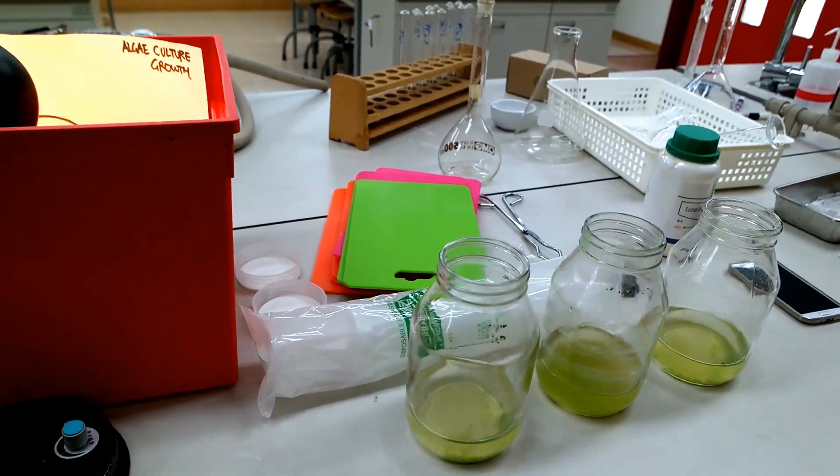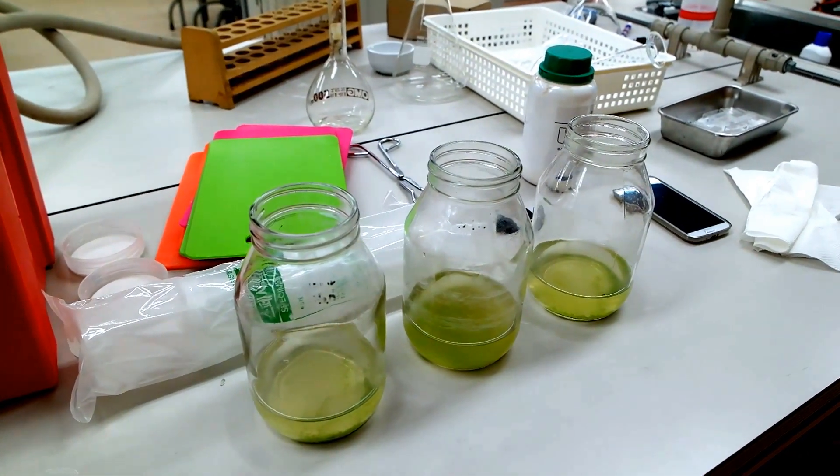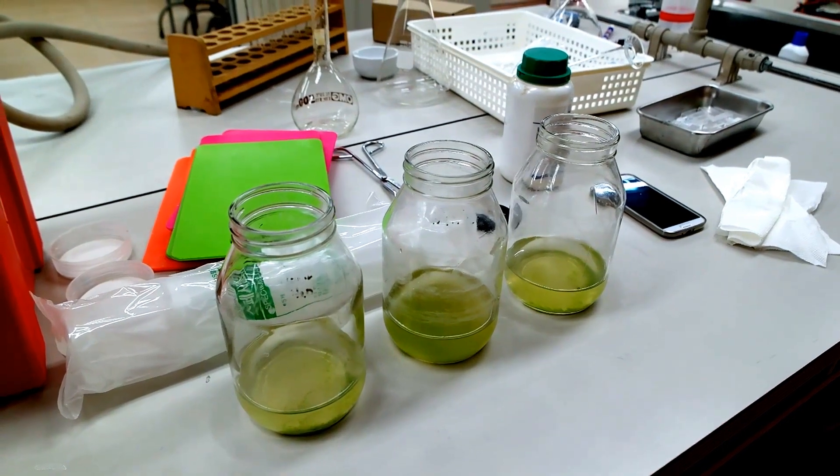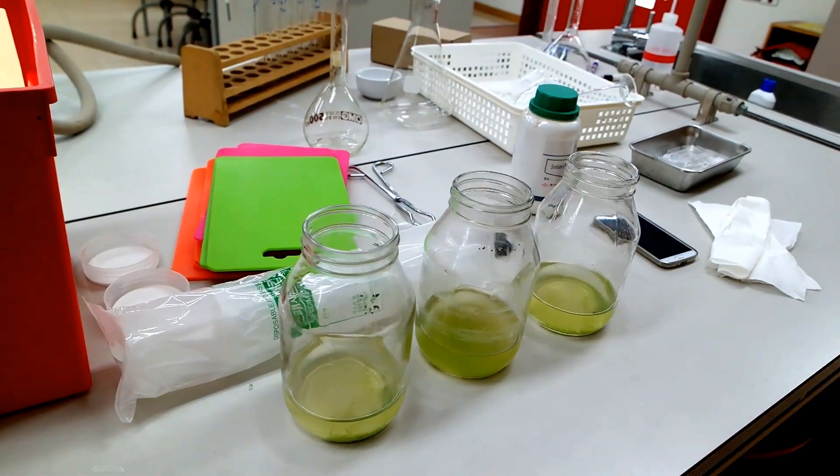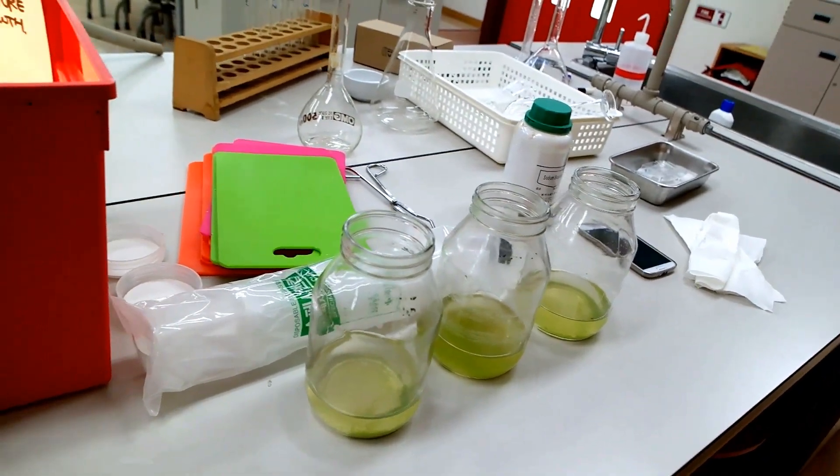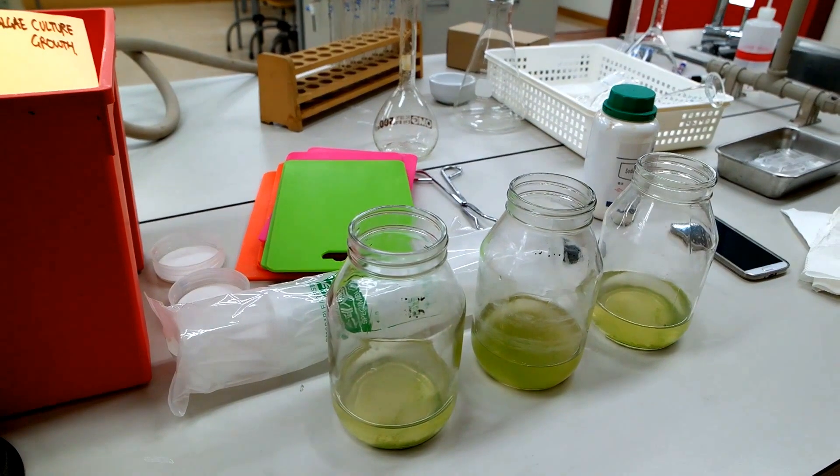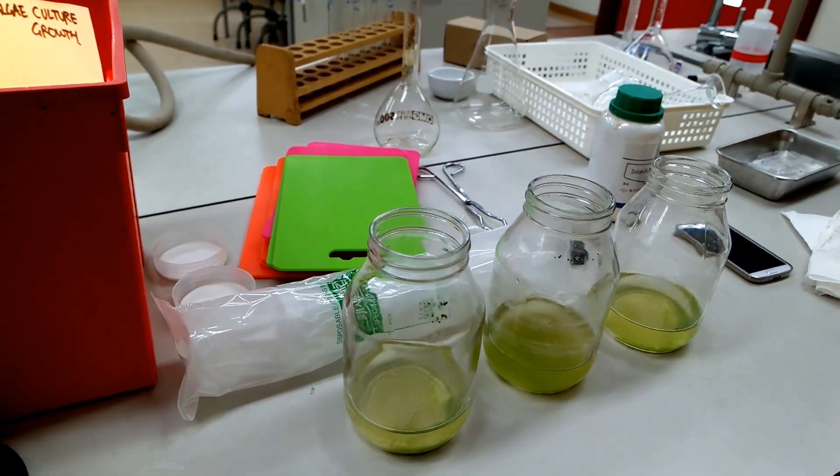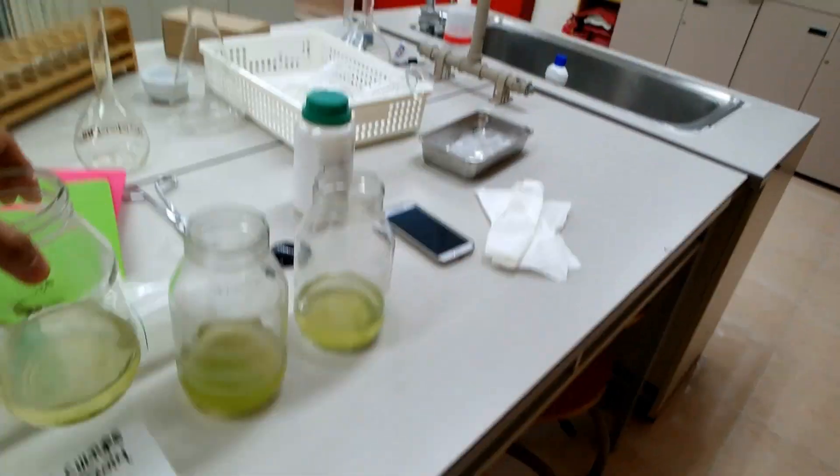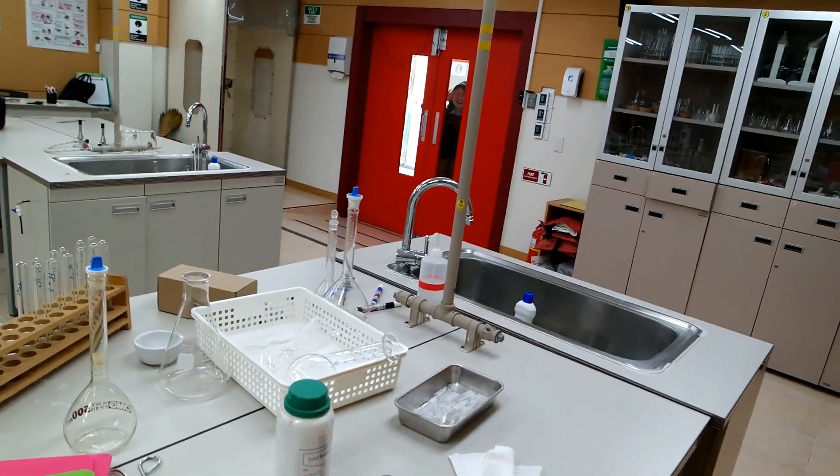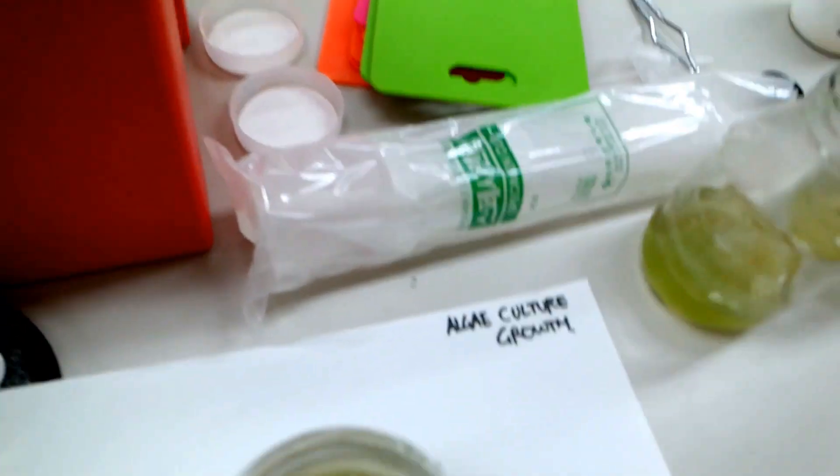The other method they suggested on the internet was to count the number of algae in one slide, which is too tiring. The only choice I had left was to check optical density or light intensity. And therefore, I made this and took photos every day.